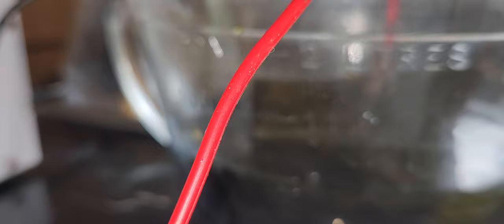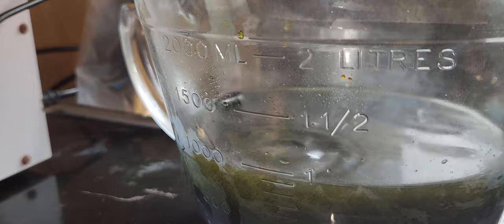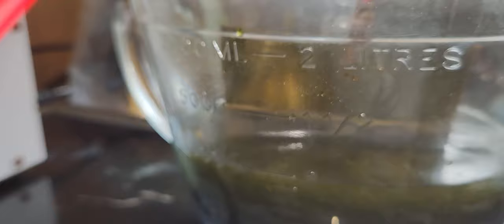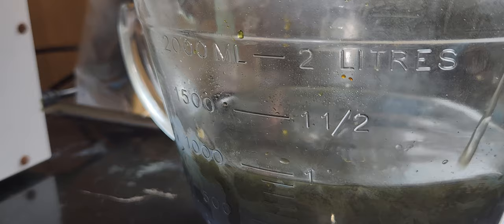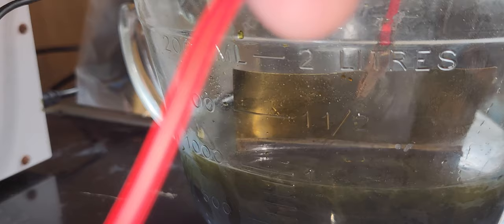Oh! Will you look at that? It is already turning a little bit black. This is working. It will take some time. But this is bismuth plating onto brass.